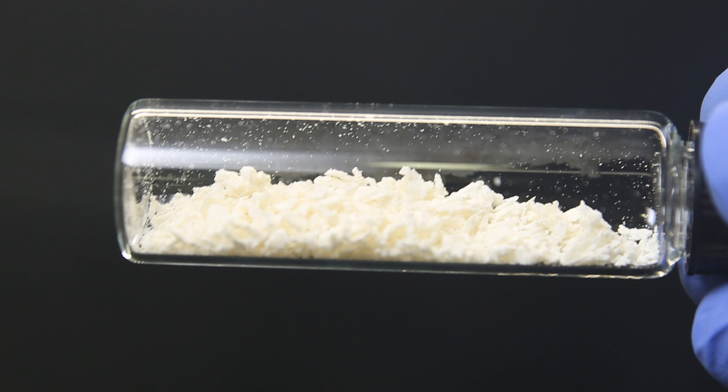In the future, I will do some H-NMR analysis to see if it is really the product. But for now, I will do a rough melting point test to get some more insight.